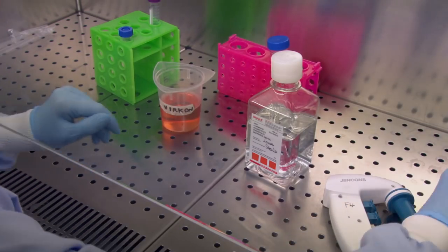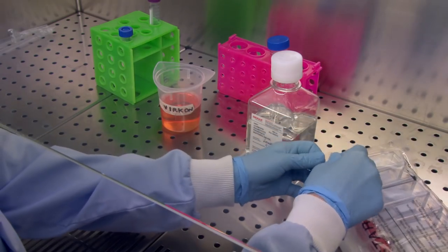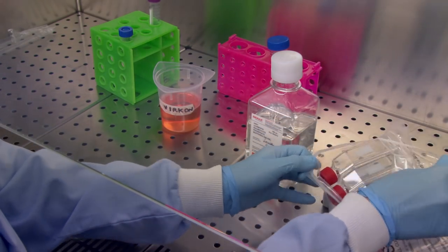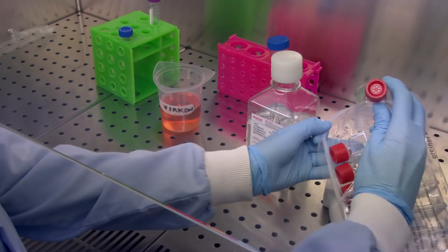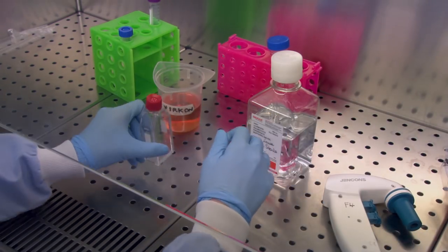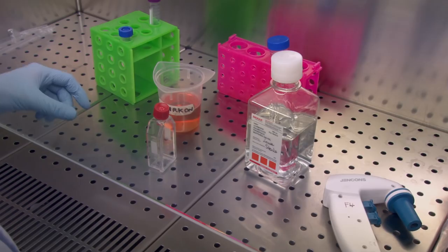Next, prepare a new flask of culture medium for the cells to grow in. Take a new flask and load a pipette into the filler.